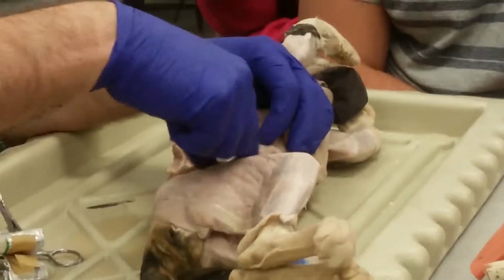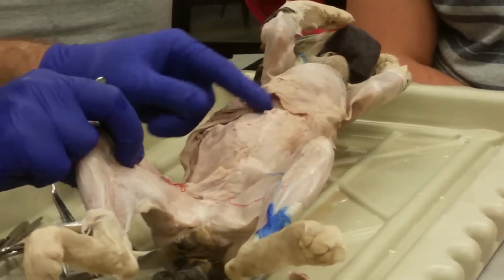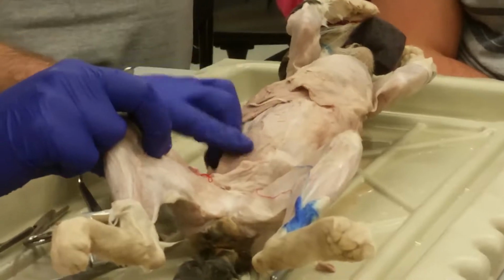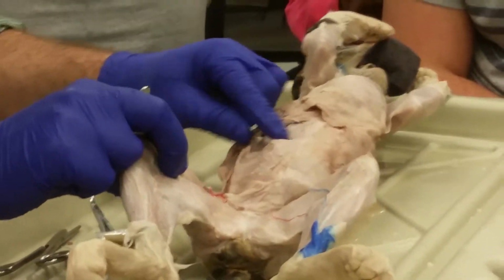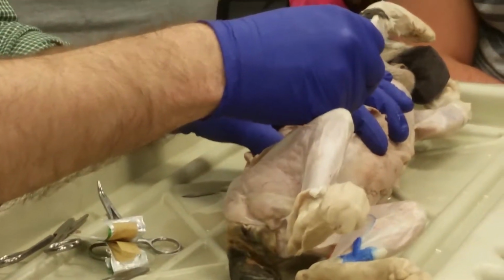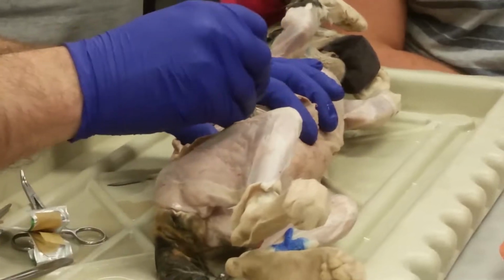So the rectus abdominis does go down along the line. Just in this cat, it is very thin. I just pulled it away a little bit. Okay? So there's your rectus abdominis going down the line there, your transversus abdominis, and your internal oblique. There's three different muscles here. You just have to come and take a look. See, there, there, and there. There's three different muscles. Okay?